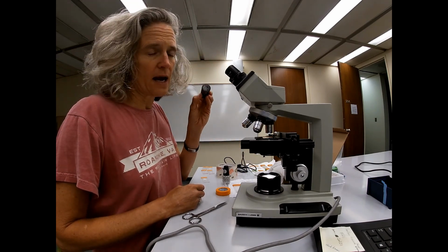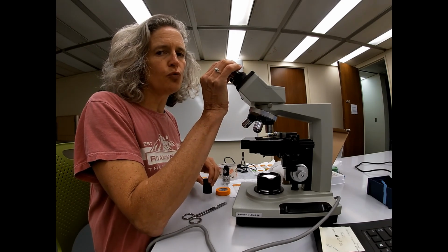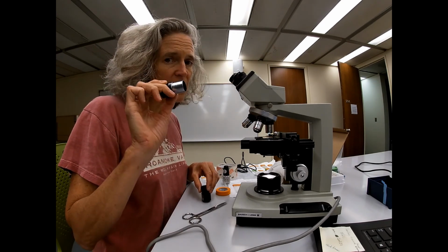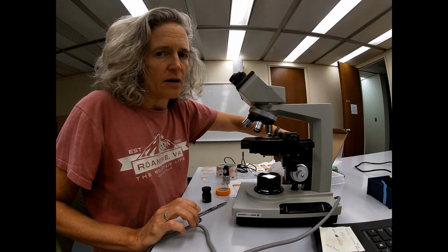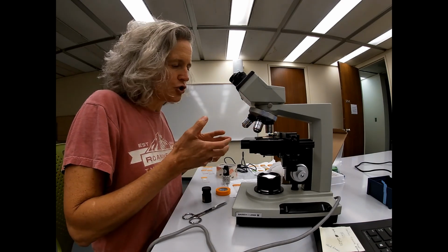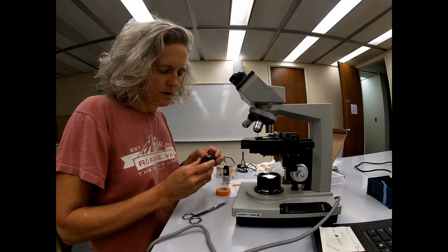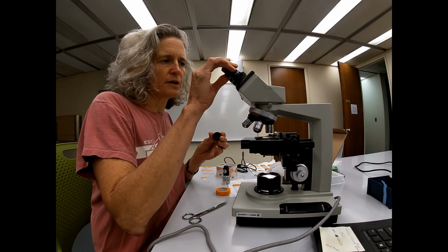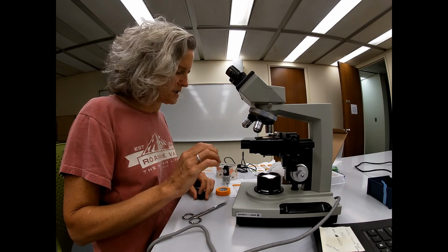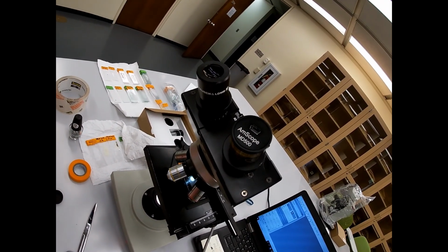So there is a camera app here, and what you need to do is carefully remove one of the ocular pieces. You need to place this ocular in the cushion that's provided by your microscope. They're very expensive. We don't want to mess that up. You then take the cap off of the camera adapter and you put the camera adapter in that ocular piece. You can then see that there is an attachment from that to the computer.